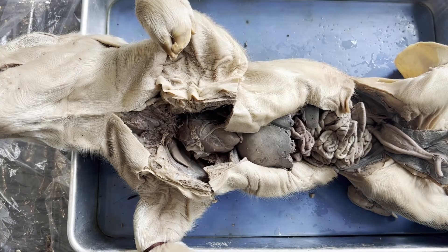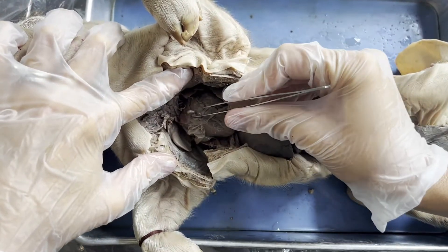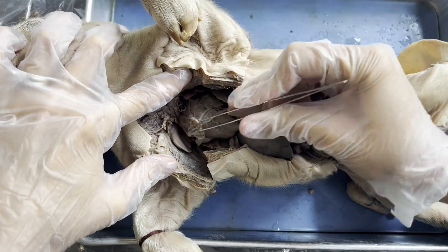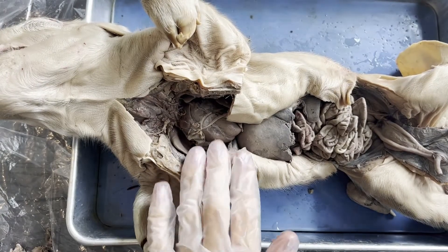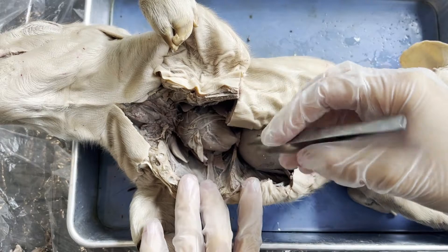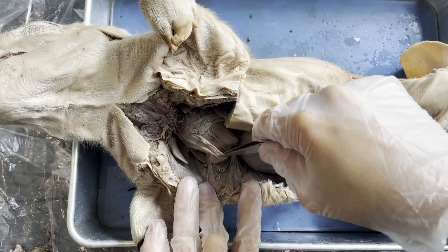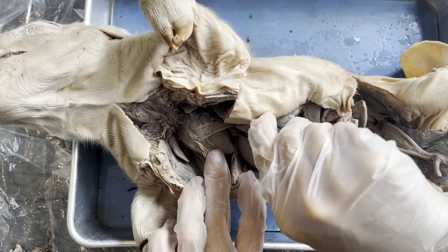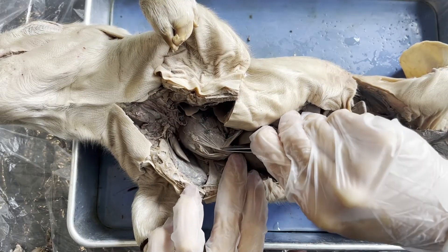I just removed the thymus gland so that we can see most of the heart. On top of the heart, I want you to notice that this muscular pump is covered with — and I broke it when I was moving the diaphragm — but it's covered with this sheath of tissue. This is known as the pericardium, or the pericardial sac.